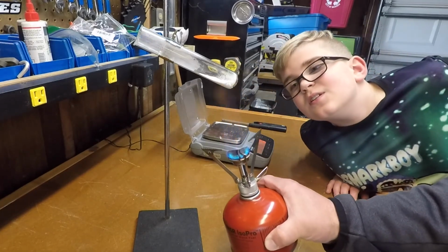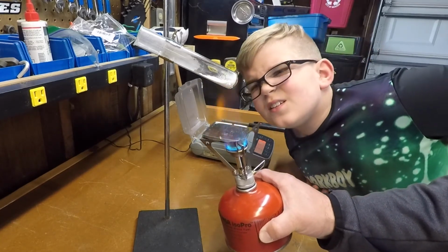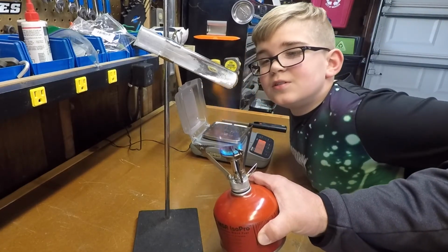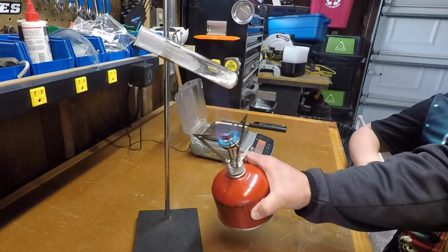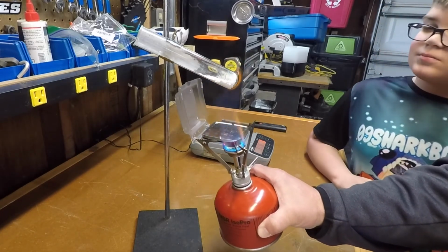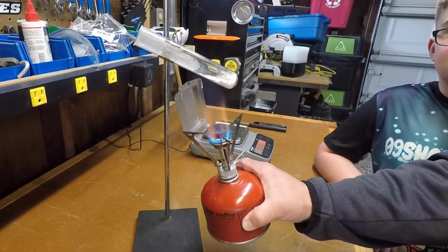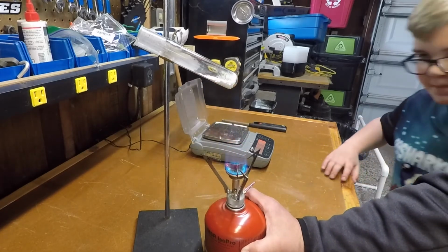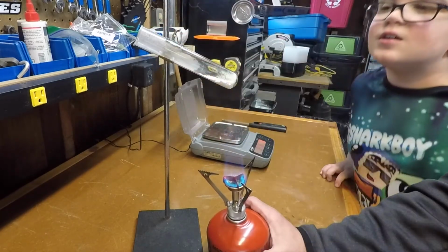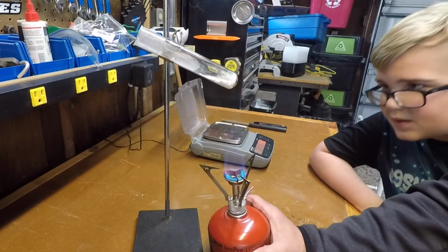Anything interesting going on there, Cole? Watch your face in the fire. Yeah, it was kind of moving around. It seemed that all the gas that was releasing seemed to be jumping around. If you look at the very top of the test tube, we can see some steam and condensation collecting.